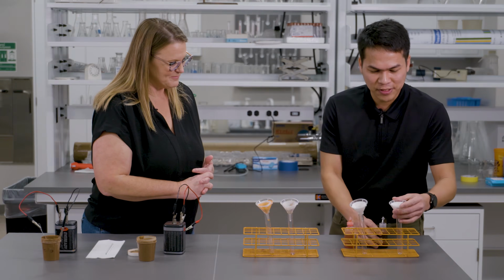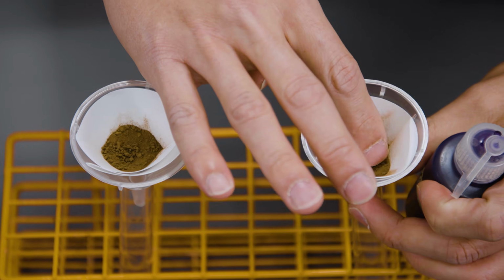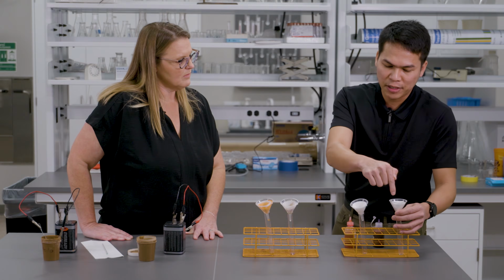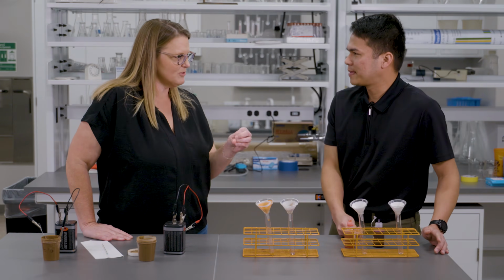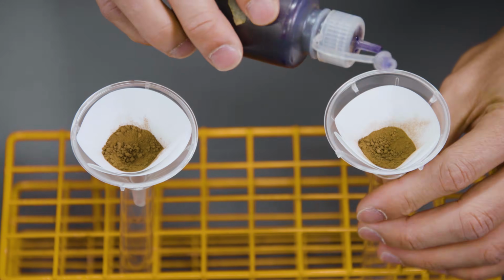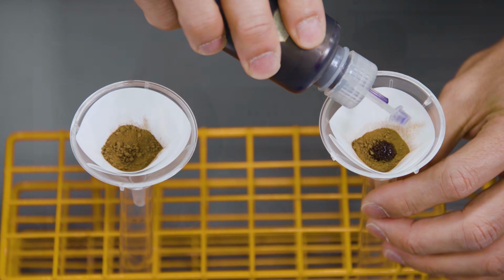So the first thing is, again, we have a soil. We'll make a depression. Why is that important? Just to have all the drops go through the soil instead of going straight to the filter paper and the funnel. So we know that the soil is actually filtering, not the filter paper. Perfect. We'll add this dye drop by drop until we collect a good amount of leachate. This usually takes time. That's why I prepared another setup.